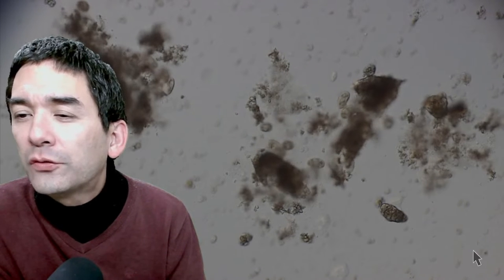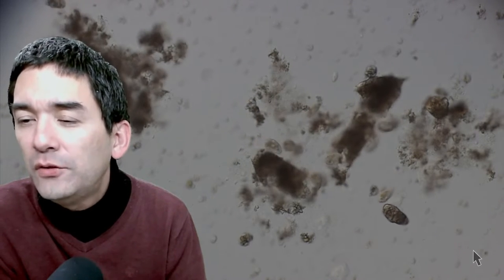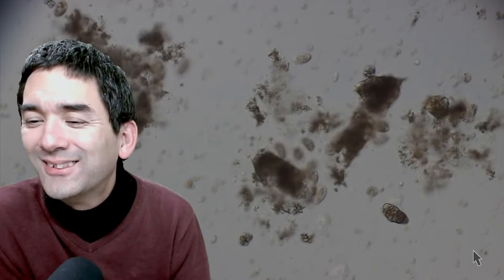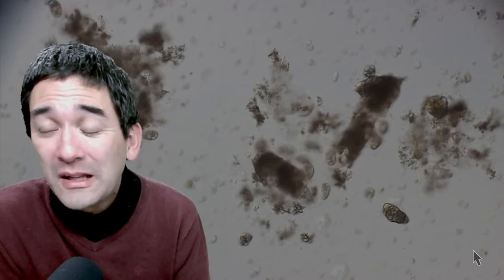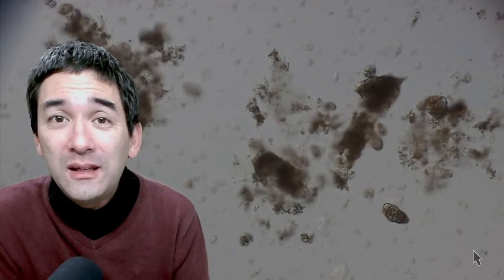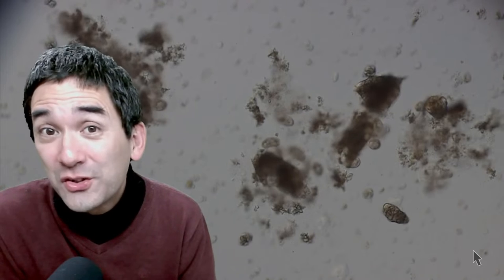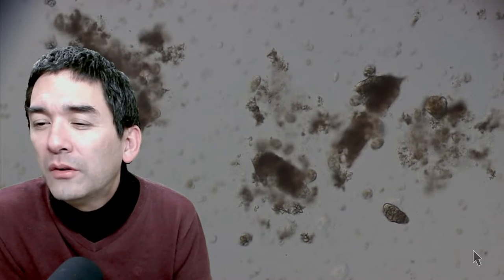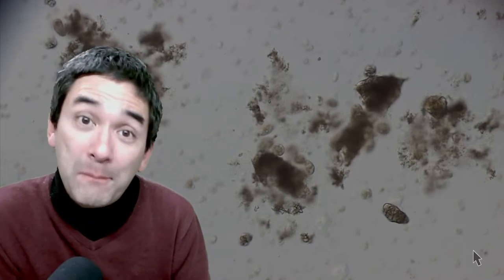If you enrich the sample with a combination of grains and milk and put some moss in for oxygen, the results can be amazing — hundreds of organisms in just one drop. Can you buy a proper condenser to fit a cheap scope? If you have an introductory microscope, most likely there is no compatible condenser — upgrading is difficult, and chances are a condenser will cost more than the whole microscope itself.